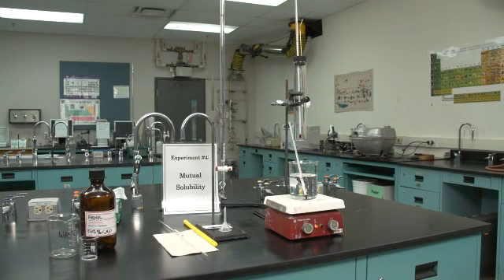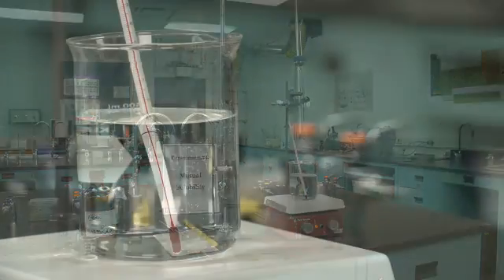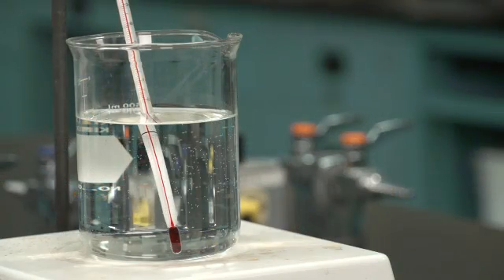In this experiment, the miscibility curve of phenol in water will be constructed. Set up a 45 degree hot water bath on a hot plate.